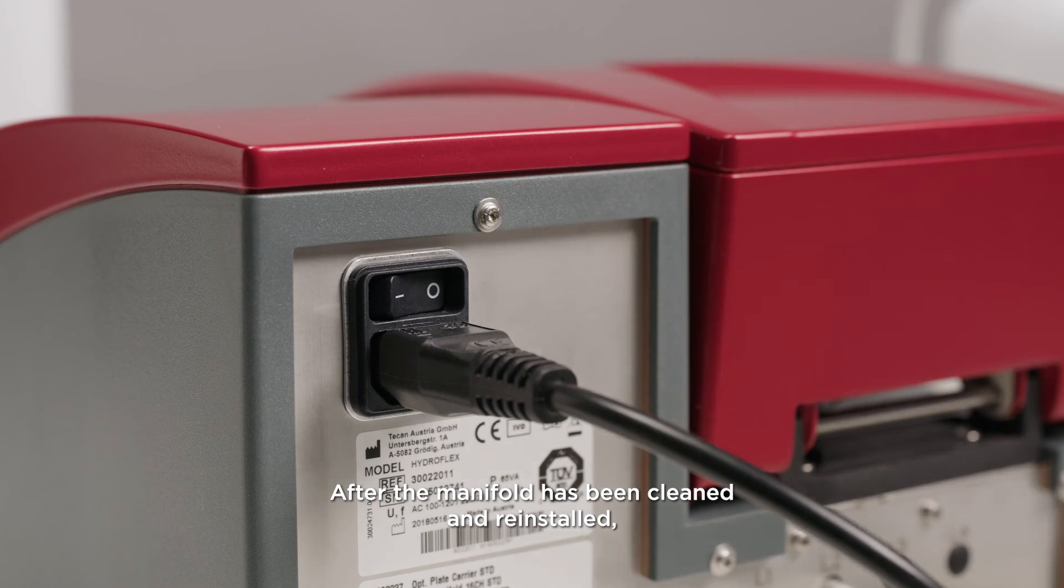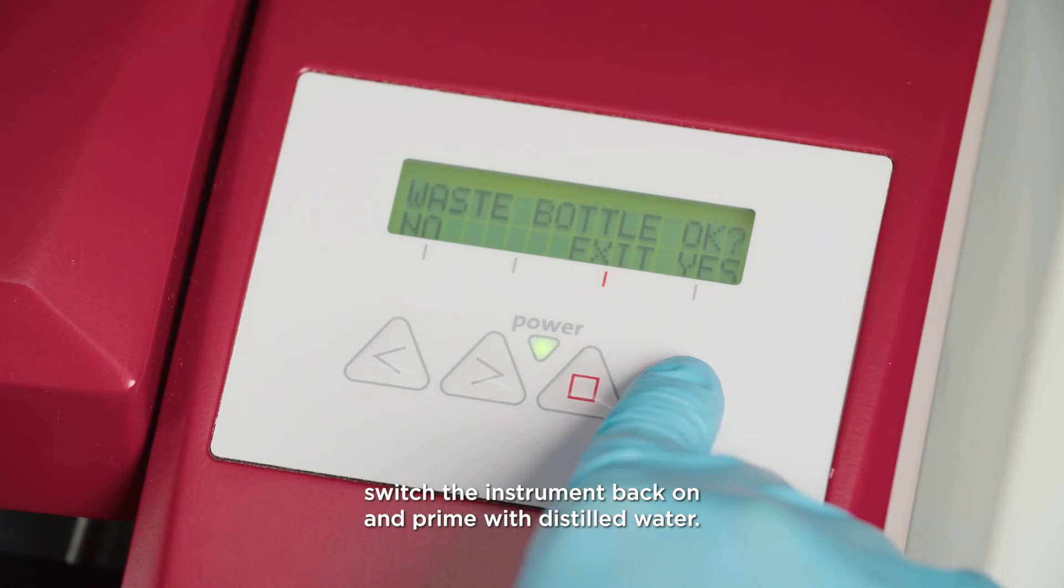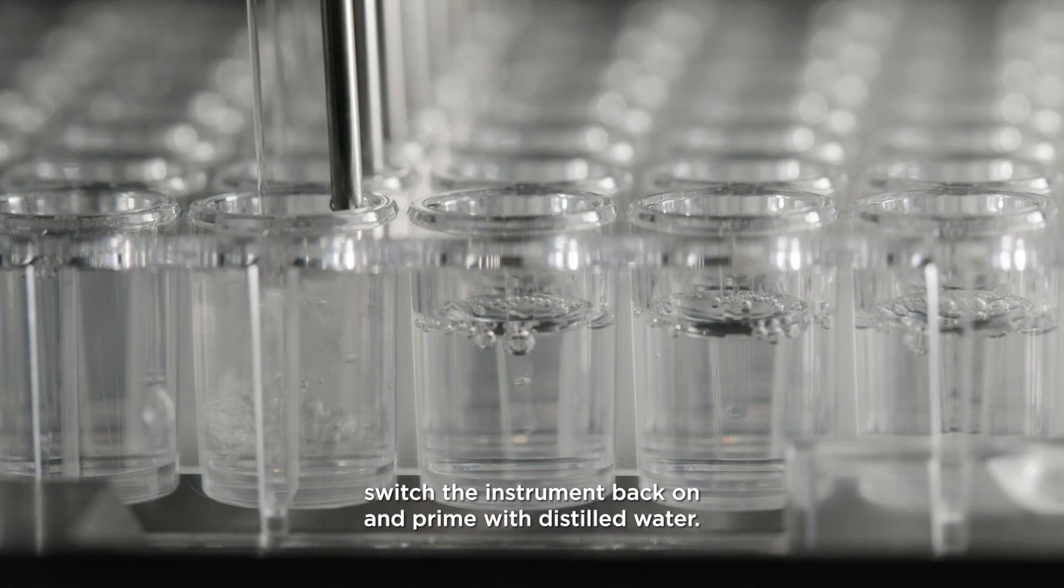After the manifold has been cleaned and reinstalled, switch the instrument back on and prime with distilled water.